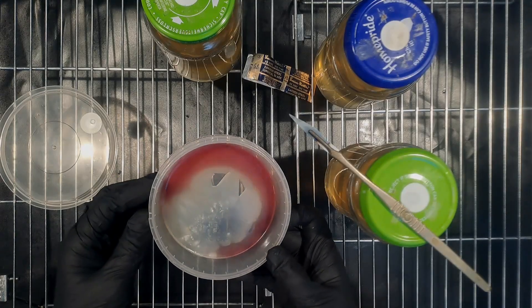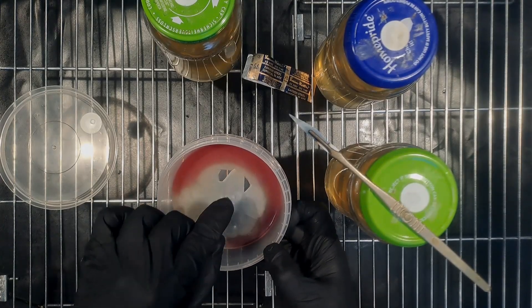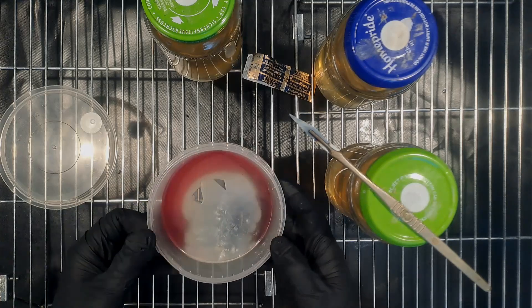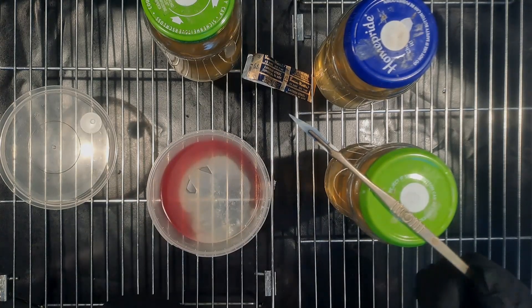I've just took the lid off for this transfer so you can see where I'm cutting the agar away from on the transfers. I'm just going to discuss now why I've chose them areas.